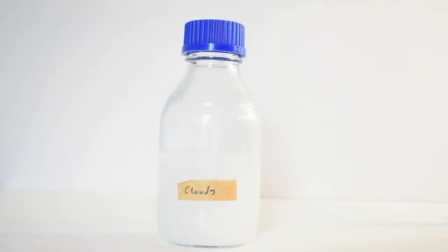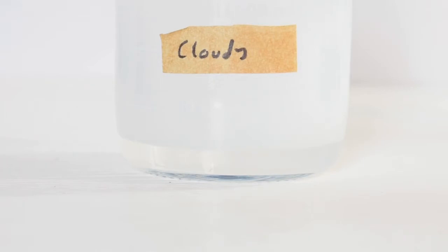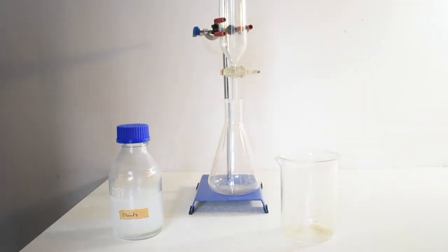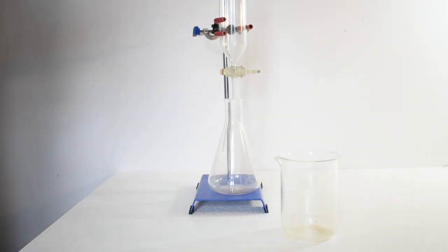Now I leave the bottle to separate out the two layers. Next, the whole bottle is poured into a beaker.